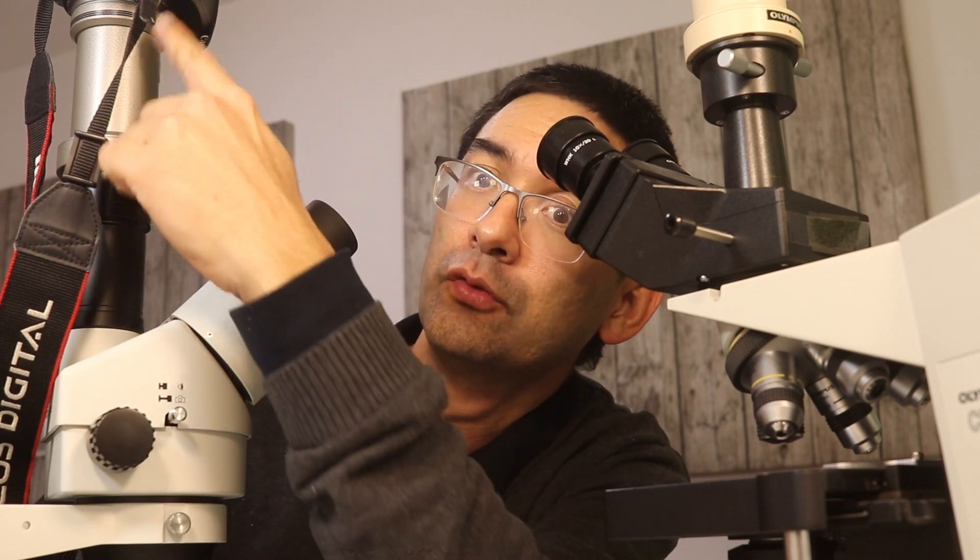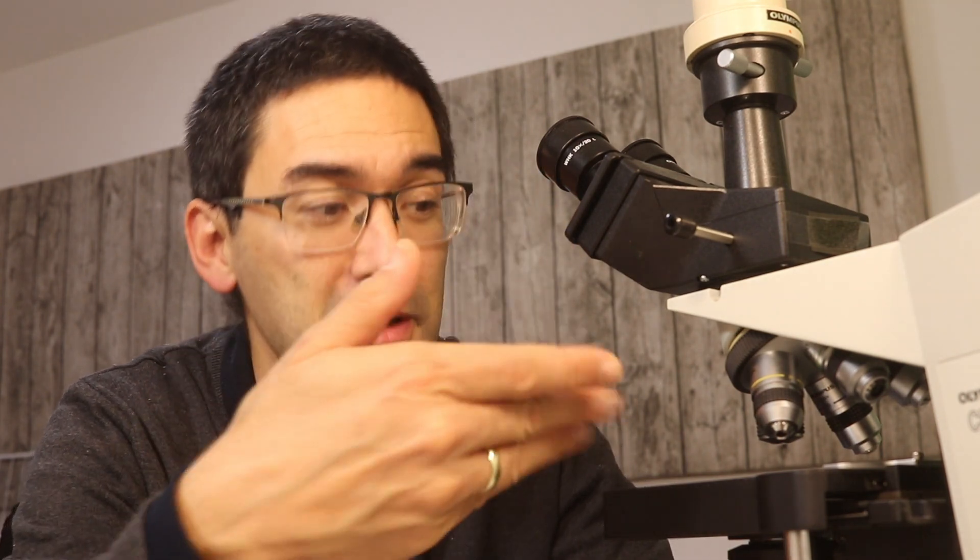Because you mentioned you are a macro photographer, I have the following recommendation: maybe before going into micro photography, you might want to explore the possibilities of stereo microscopes. I have one here — that's my new stereo microscope. It allows you to take very good pictures; I also have a digital reflex camera mounted on it. If you don't have specific interests in specific specimens, a stereo microscope might be an option to consider. A good plan apochromatic objective costs around 1,500 to 2,000 euros and upwards just for the objective — not the microscope. You can get a decent stereo microscope already for a few hundred euros or dollars.